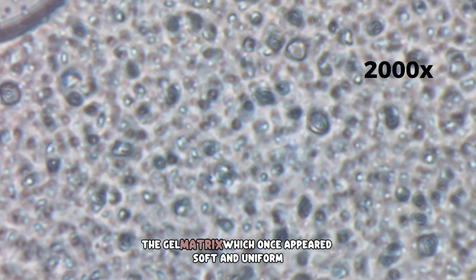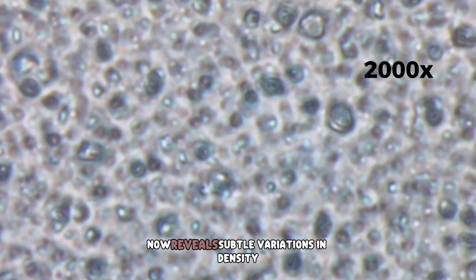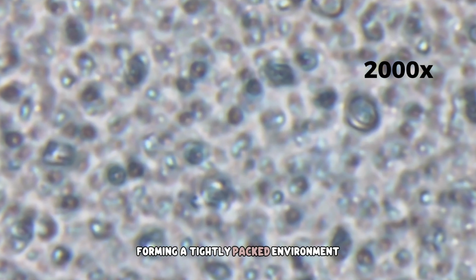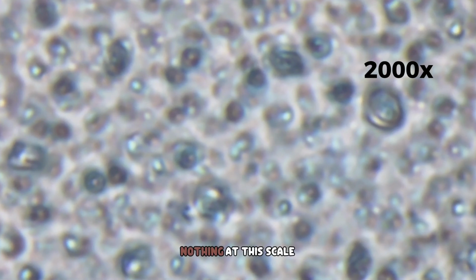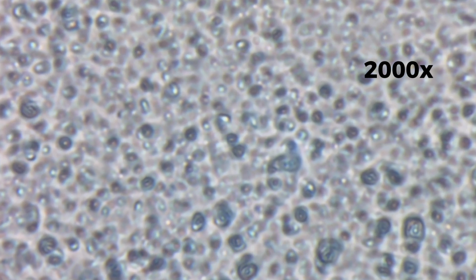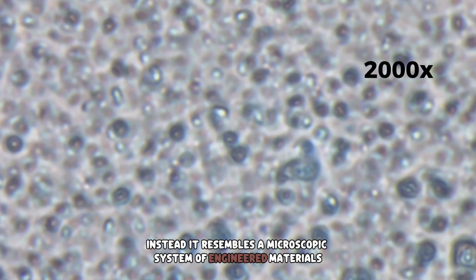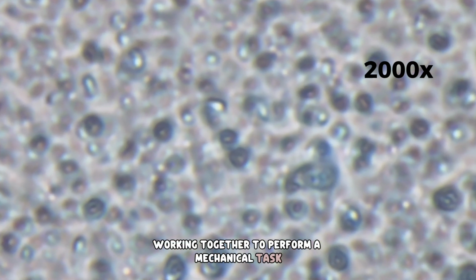The gel matrix, which once appeared soft and uniform, now reveals subtle variations in density, forming a tightly packed environment that holds every component in place. Nothing at this scale resembles the gentle paste applied to a toothbrush. Instead, it resembles a microscopic system of engineered materials working together to perform a mechanical task.